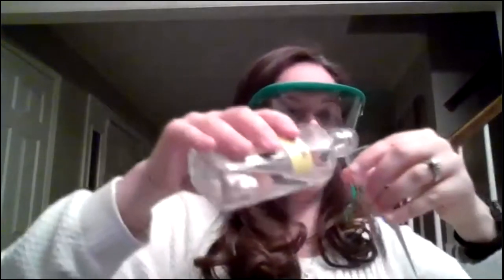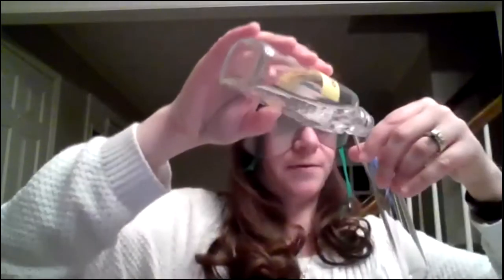So now let's look at our acetic acid and sodium acetate buffer. So this is a combination of acetic acid, and then the acetate ion comes from the salt sodium acetate. So I'm going to put that in 2 test tubes. Here's the other one. And I'm going to add universal indicator so we see what color it is. And so it's acetic acid and acetate, so it's an acidic buffer. So the initial pH of the buffer itself is, I'd say probably a 3 or a 4, something like that. It's kind of orange color.